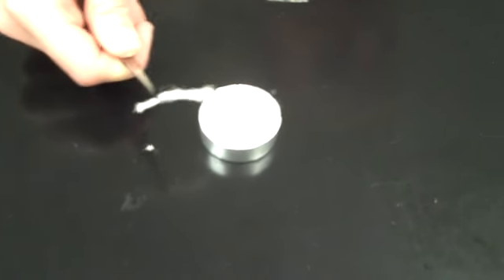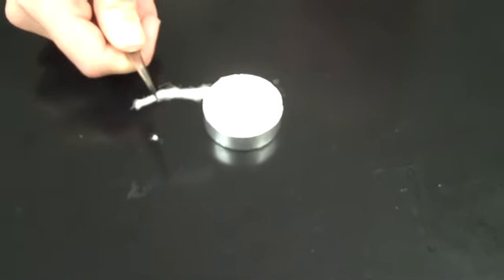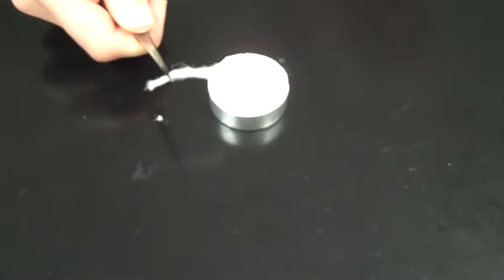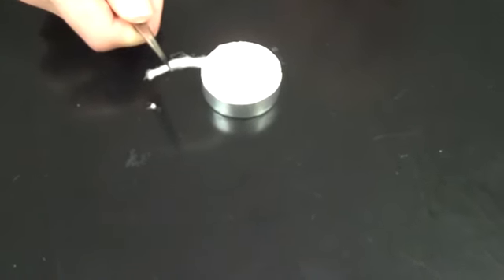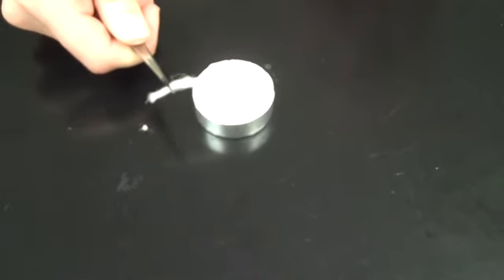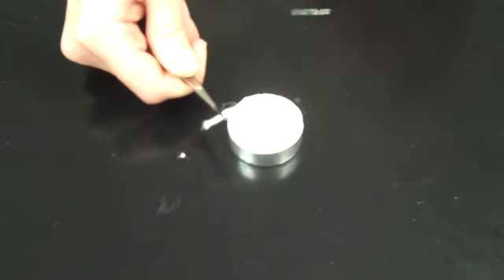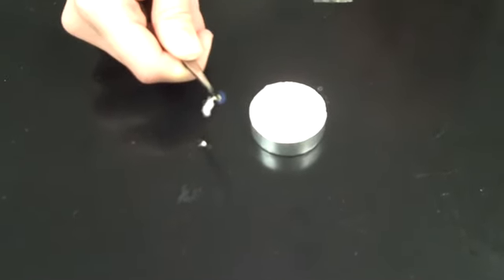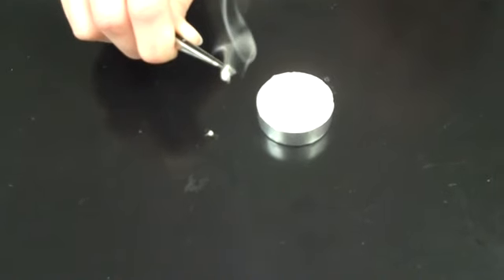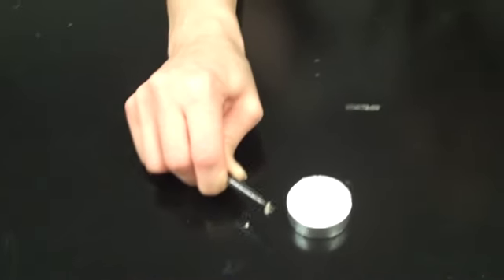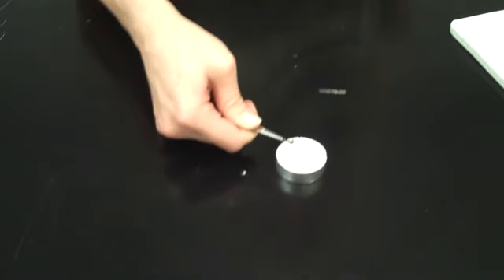Then I'll also go ahead and burn it now and check for those other characteristics—if it flames, the size, the color, how fast, the smoke, all of that, and the smell. It does not self-extinguish; it continues to burn. It even got over onto the other side. There's my smoke.